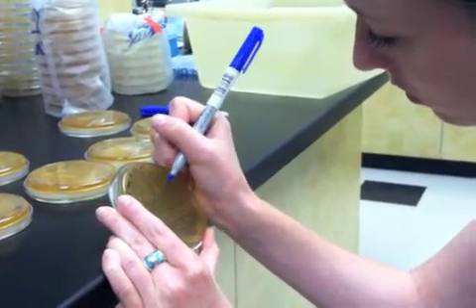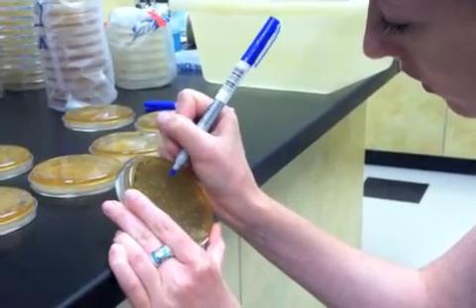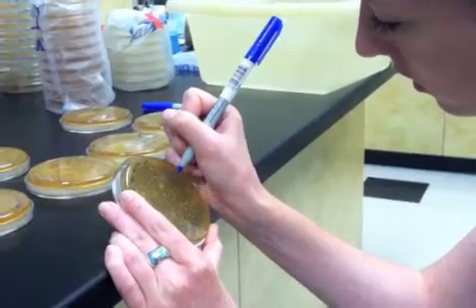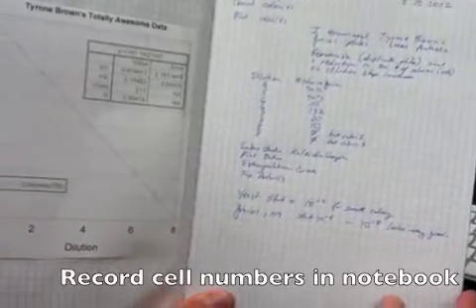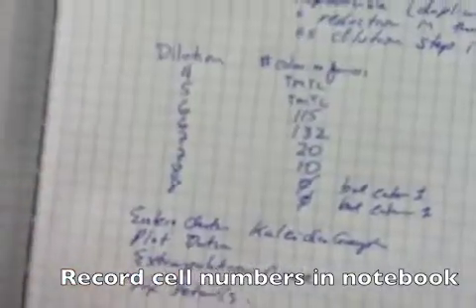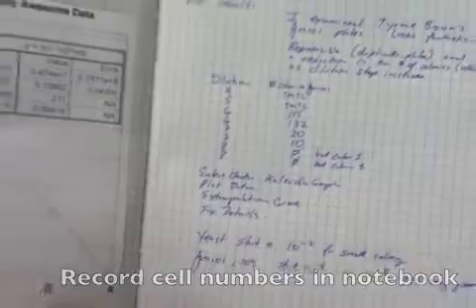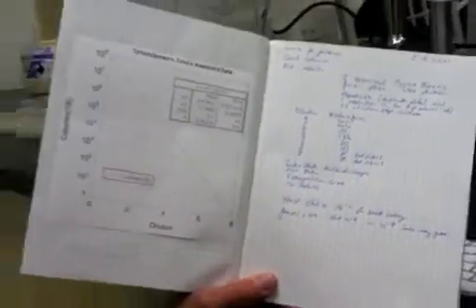And when she gets to the last colony, she makes a note directly on the plate of how many colonies were counted. I have recorded how many colonies were counted on different dilutions of the plates, and now I'm getting ready to analyze this data to arrive at an estimate for the number of cells in the original colony.